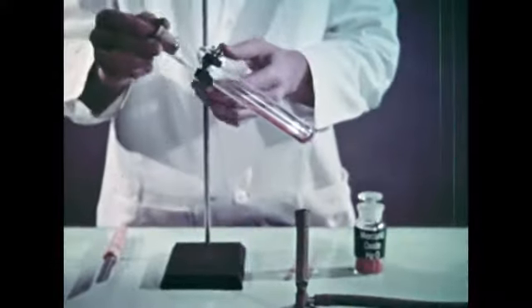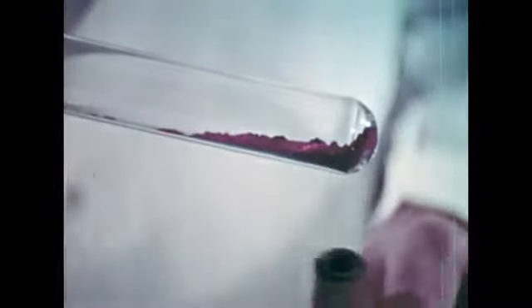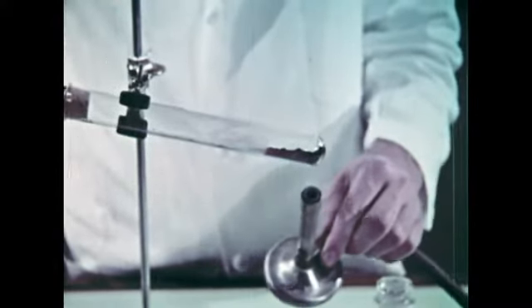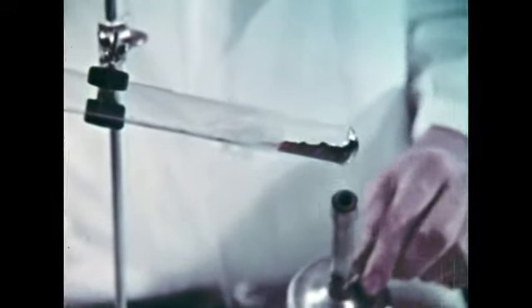Here we'll do only the preparation of oxygen. The test tube is corked before heating to prevent the poisonous mercury vapor from escaping and also to help retain the relatively small amounts of pure oxygen produced. After heating for a few minutes, there is a visible change in the color of the mercuric oxide. This is probably due to the rearrangement of molecules or to a change in the crystalline form of the solid.